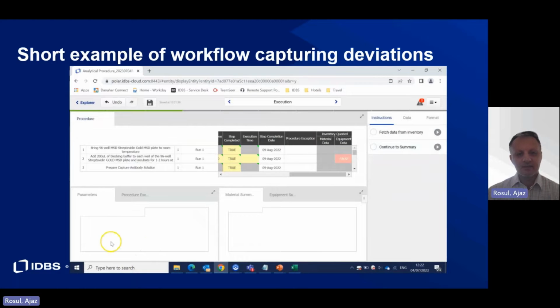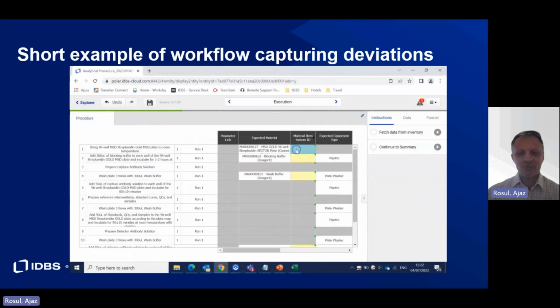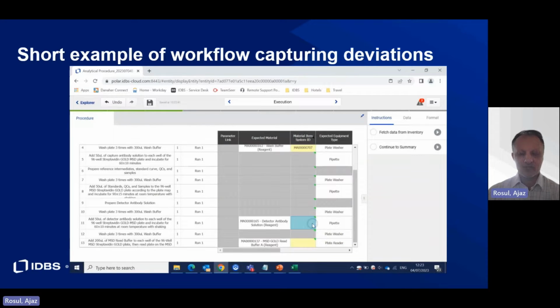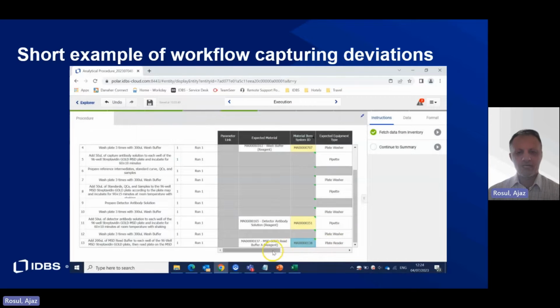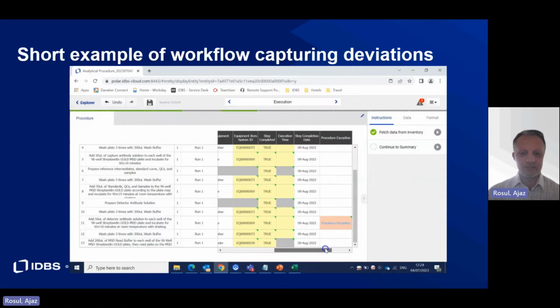What I'm showing now is an example of how a Polar bioanalysis workflow is designed to capture real-time deviations during an analytical run. The user assigns the required method ID and procedure ID, and is then presented with the appropriate steps for performing the assay.